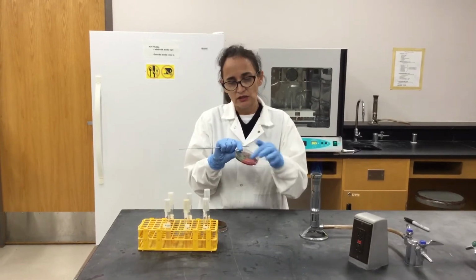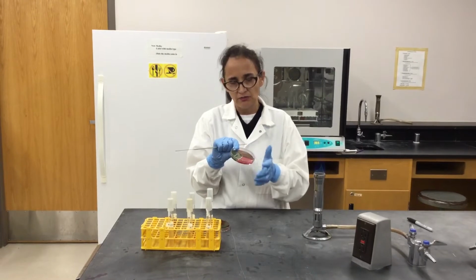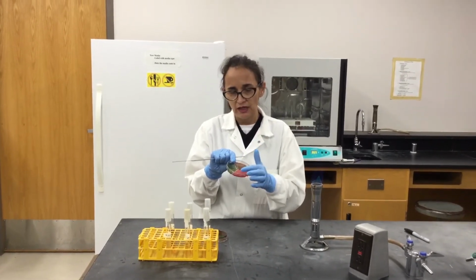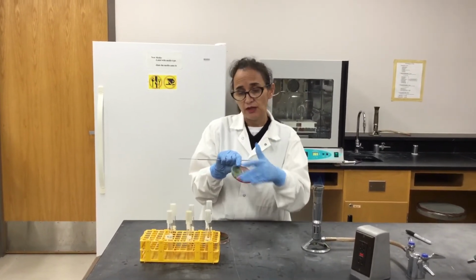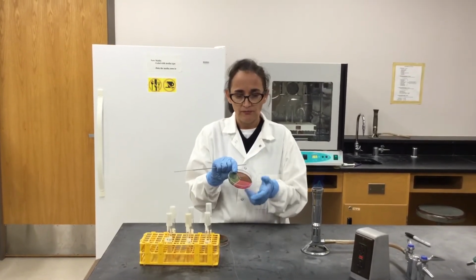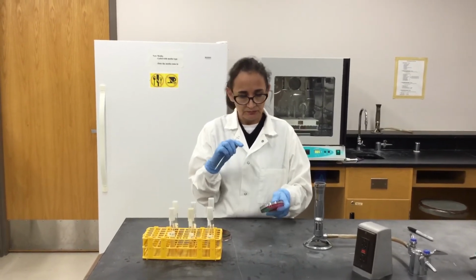You can use these 3 types of media, or you can have a single type of media, and then you can have a negative control where you don't grow anything, and then a positive control for a bacteria that you know, for instance, ferments citrate, if we have only citrate in this plate, and then a negative control for one bacteria that doesn't ferment citrate.